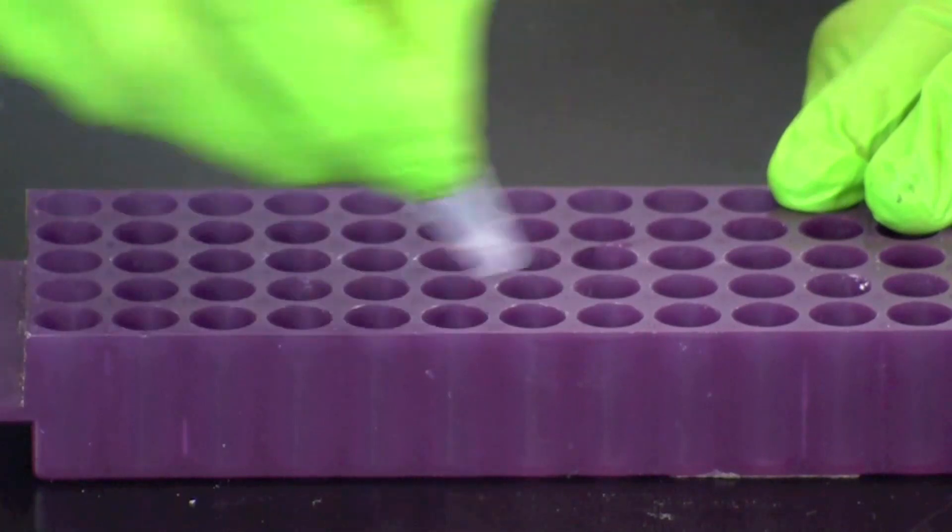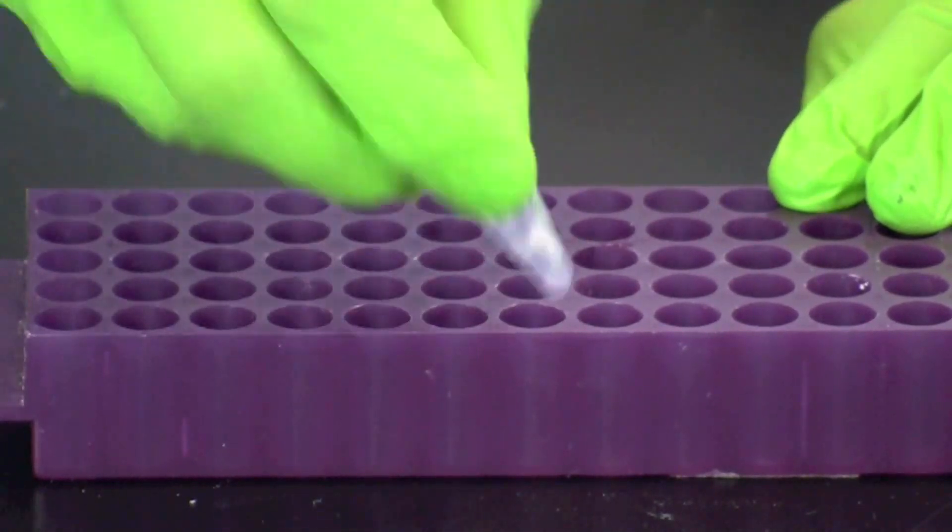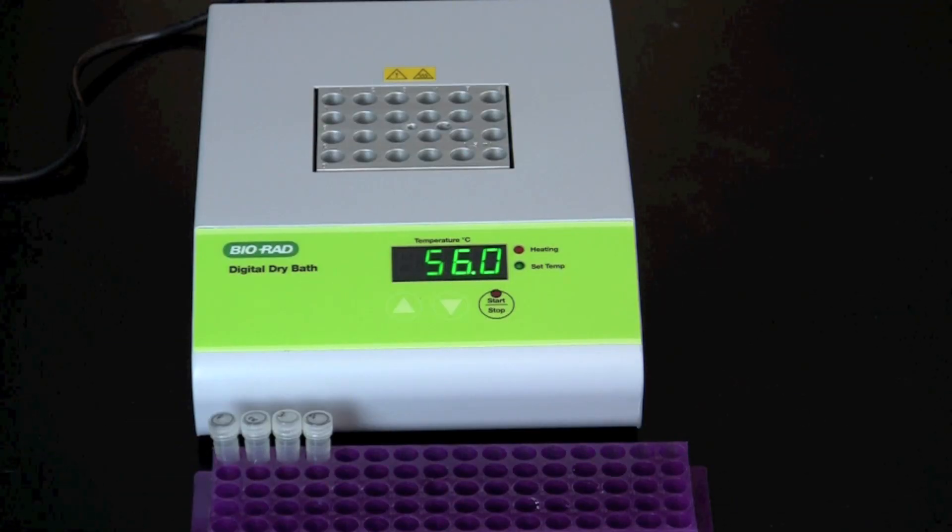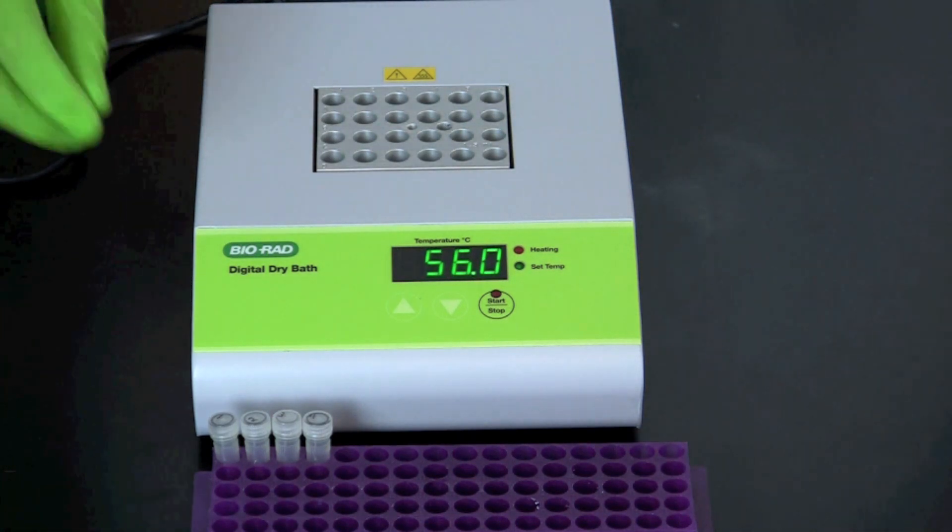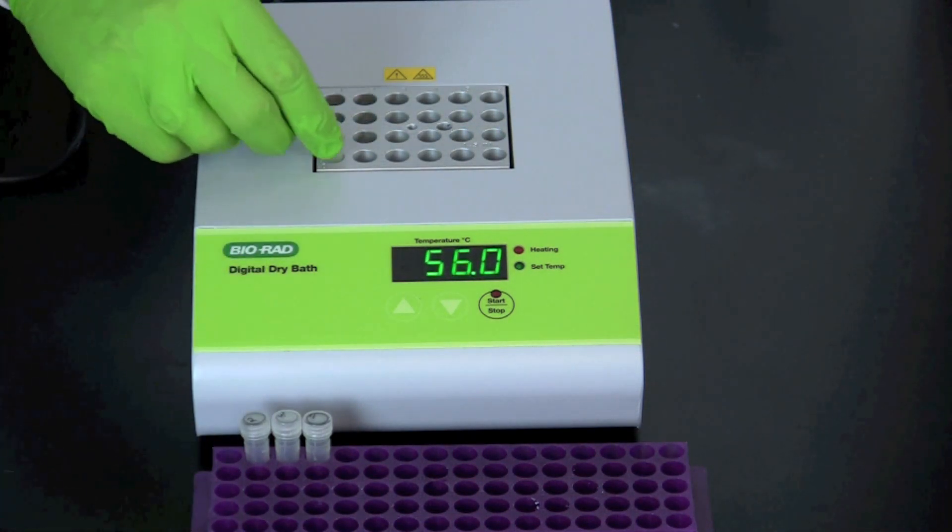Screw the cap on tightly and vortex or shake the tubes. Incubate the screw cap tubes at 56 degrees Celsius for 10 minutes.